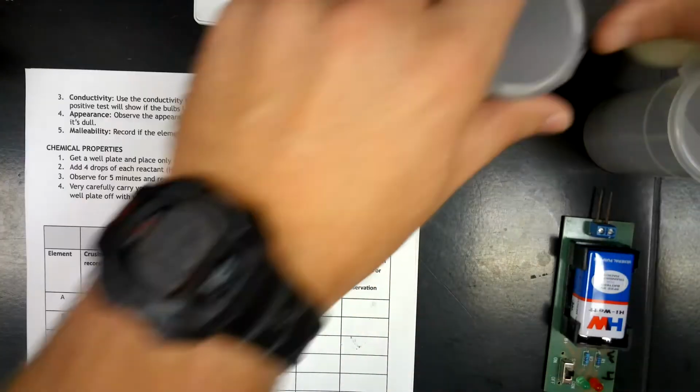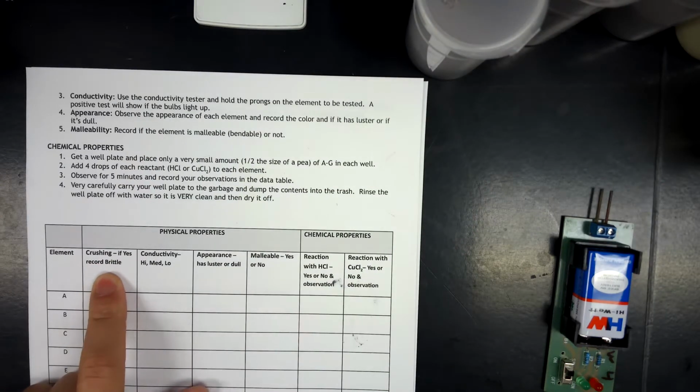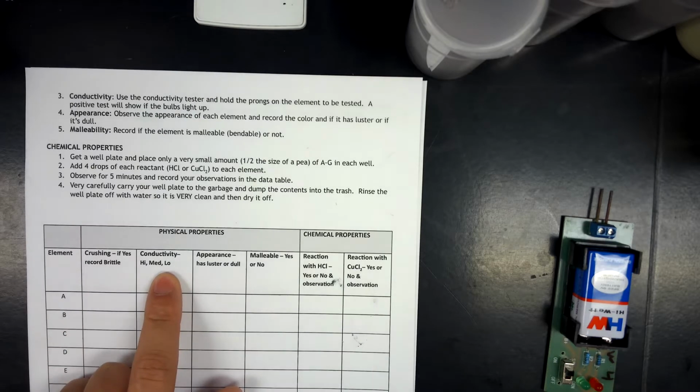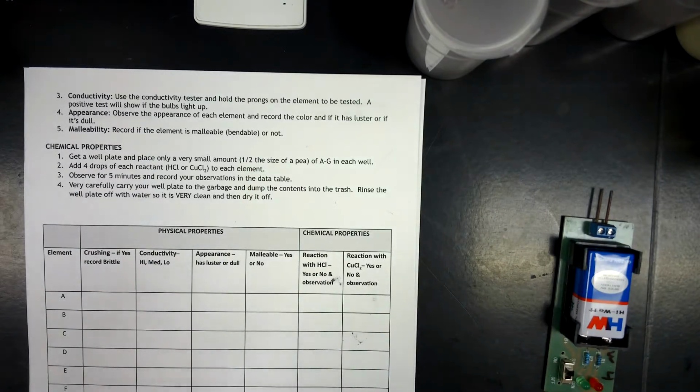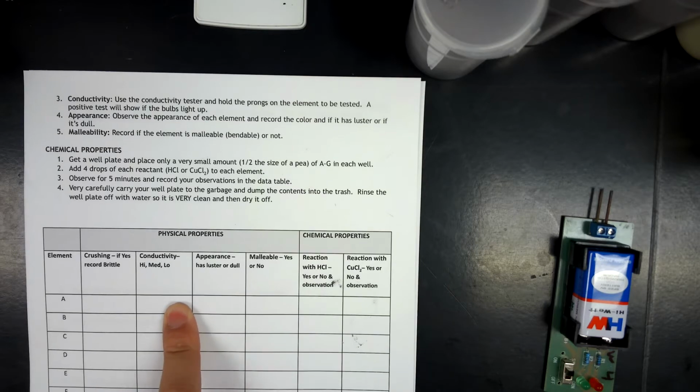Some of the things that we're going to look for today include if it can be crushed or not, so if it can become a powder or not. This one is particularly hard to do with small particles, so there's a little test that I'll do. Conductivity, same thing. When we get these small particles, some of these tests just become a little bit more difficult. That's why we're looking for trends and looking for outliers.